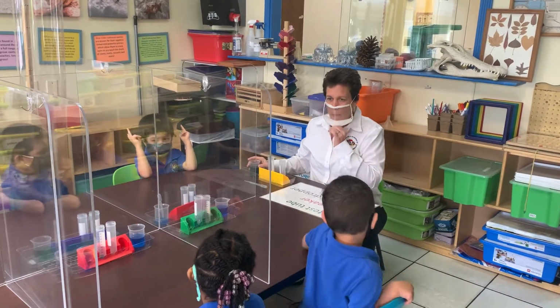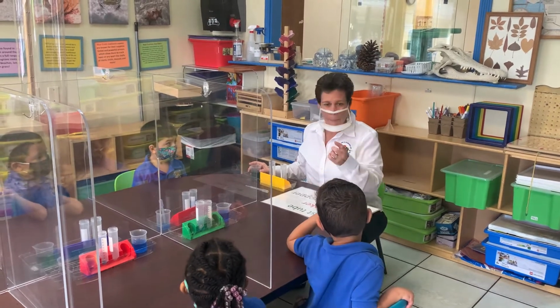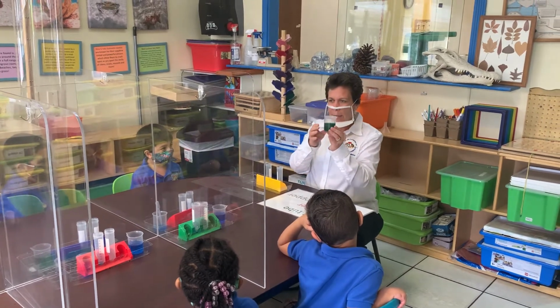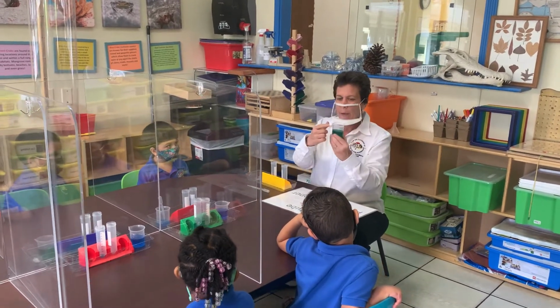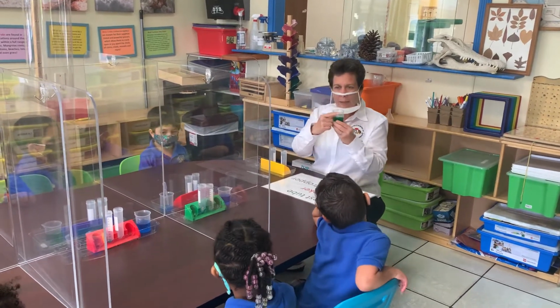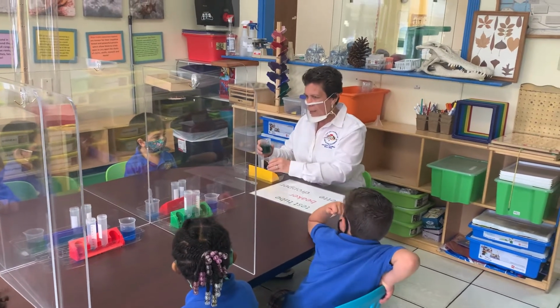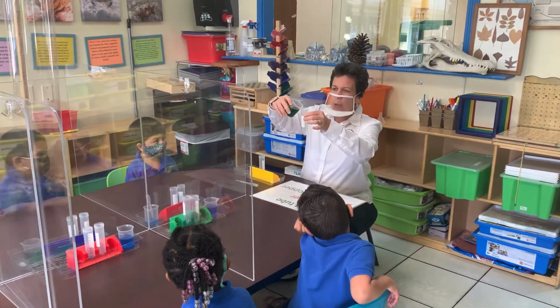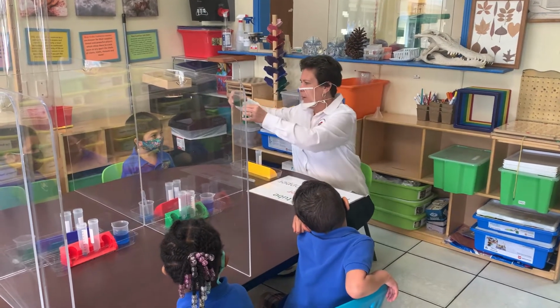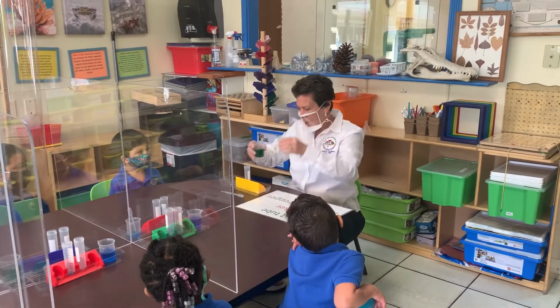Now, a bird, do you know what the nose of a bird is called? A beak. Well, the reason this is called a beaker, it's a container that holds liquid, but do you see this little front part of the beaker? It looks kind of like a bird's beak, right? And it makes it easy for a scientist to pour something into a test tube because that little beak makes it easy to pour. Okay?